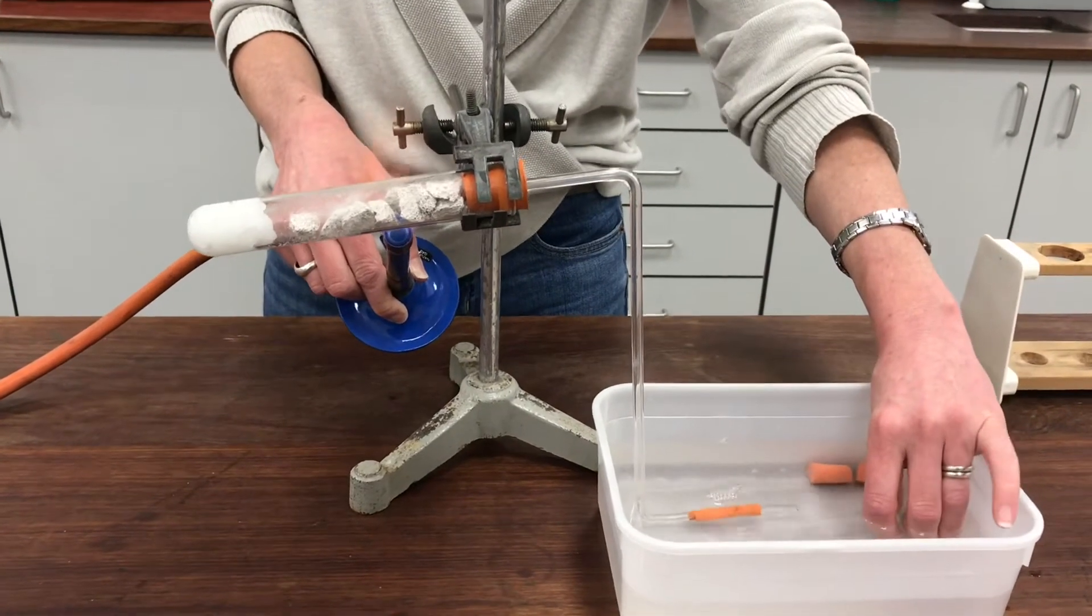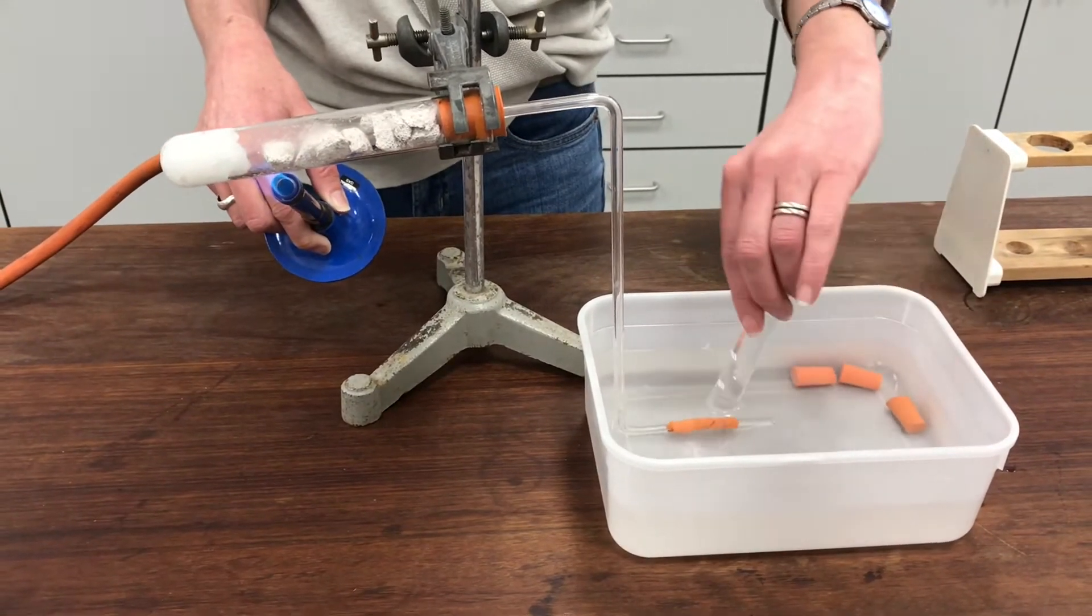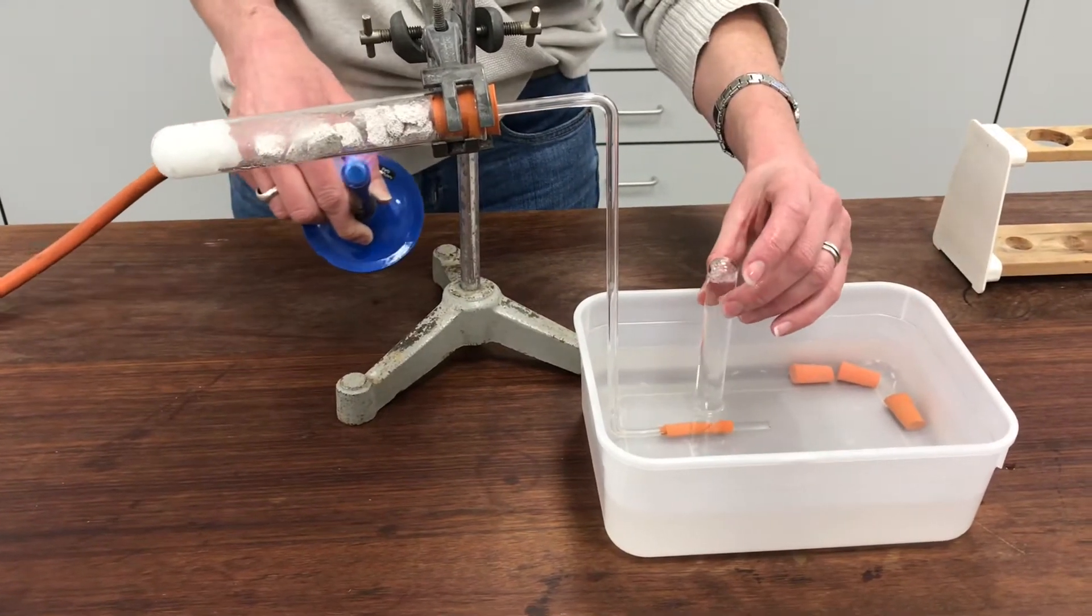And now I'm going to start flicking my Bunsen onto the paraffin and I'm going to start collecting the bubbles in my test tube.